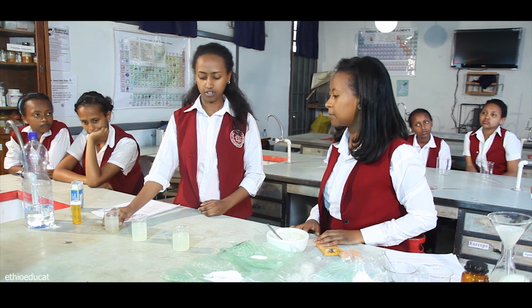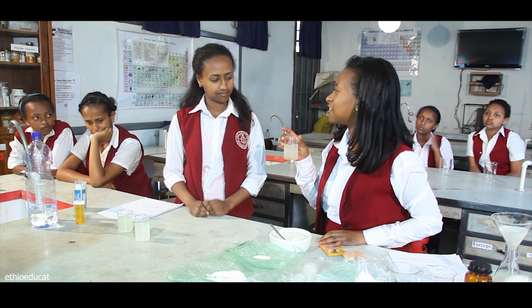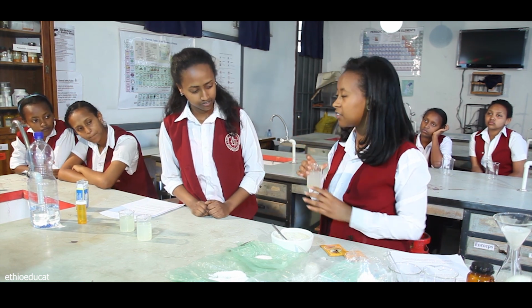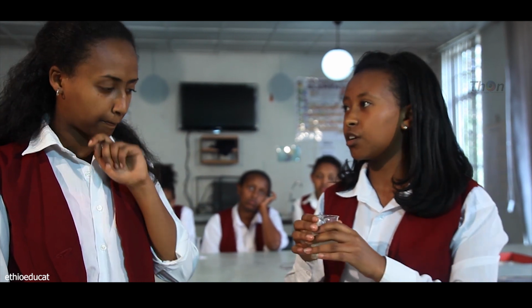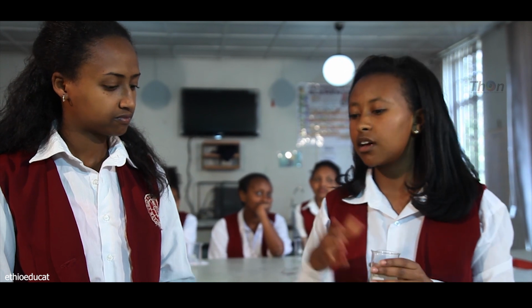What about in this beaker? In this beaker, as you see, what do you think I did? You ground the sugar. Yes, I added a ground sugar into this lemonade. When you grind the sugar or any substance, you reduce its size. So in that case, its surface area per volume ratio increases so that more collision occurs and the sugar dissolves faster than the unstirred and unground one.